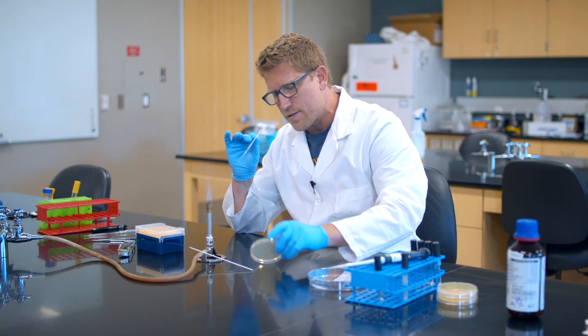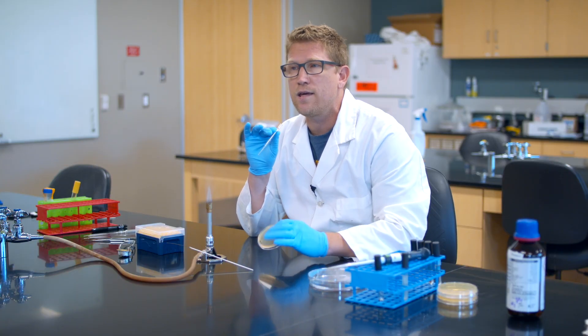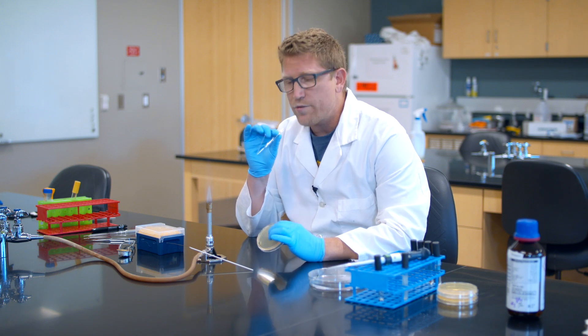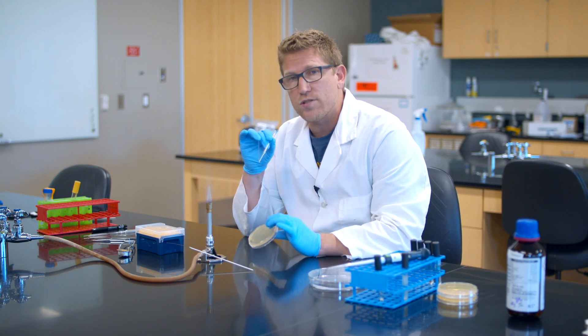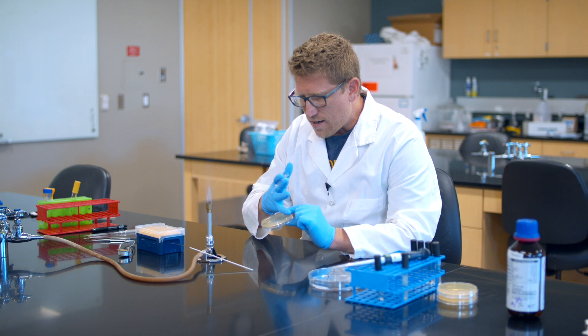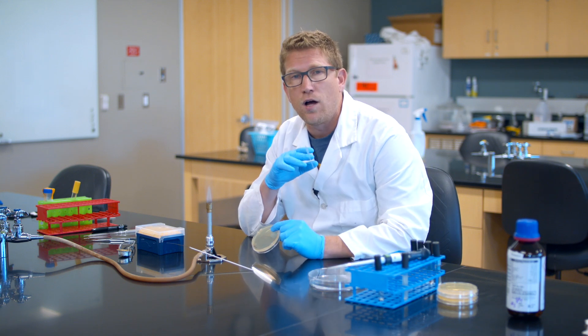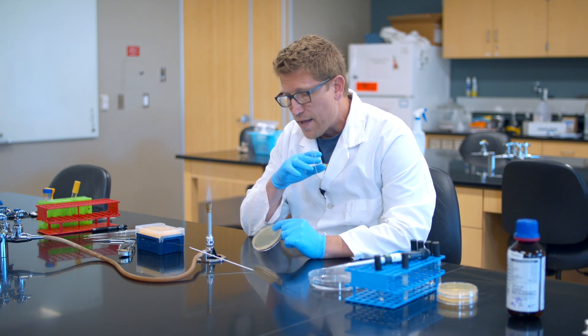I'm going to put my lid on, flip this guy upside down. That's going to go in the incubator. And what we would expect from this one, because it was such a heavy dose, is confluent growth, what we call a lawn, all the way across the surface.